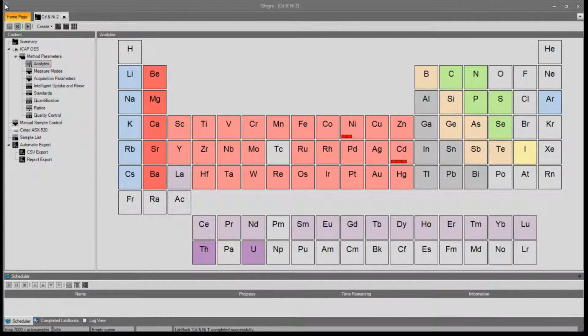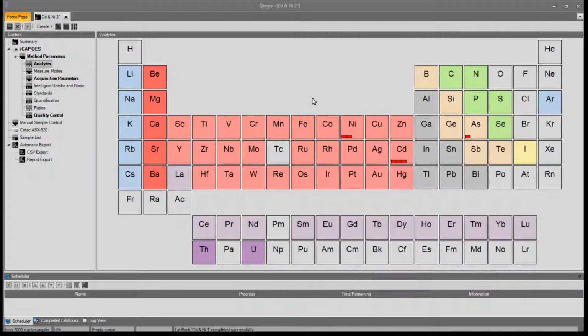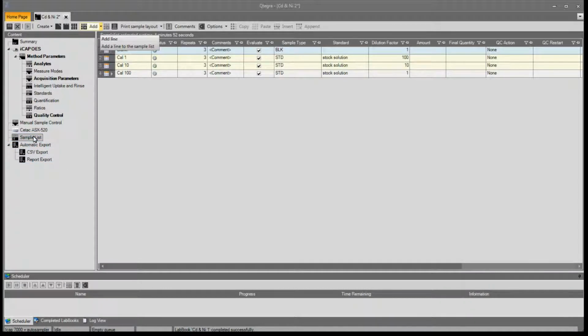To activate the inter-element correction function in the lab book in order to compensate for a known interference, start by selecting the interfering element. Select a non-interfering wavelength. If the concentration of the interfering elements is not of interest, then there is no requirement for them to be calibrated. In addition to the calibration standards, some extra samples are required.